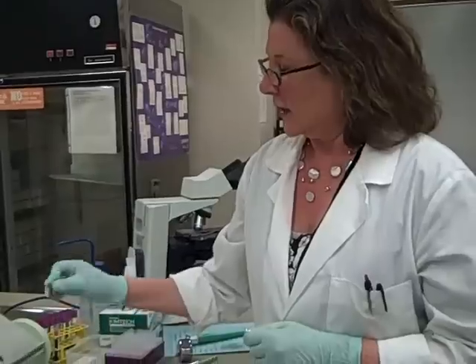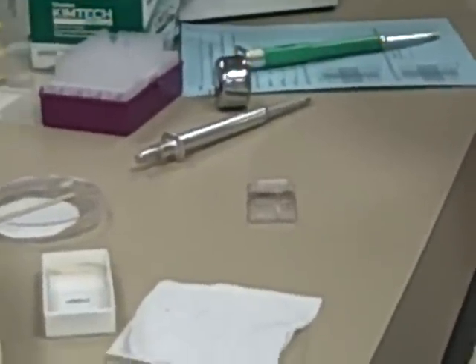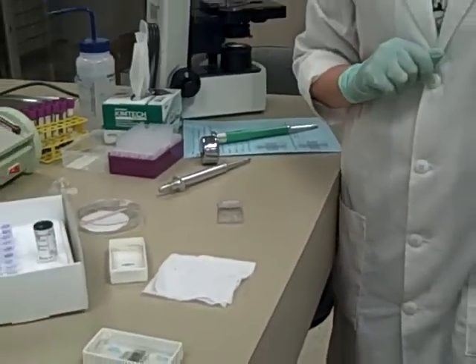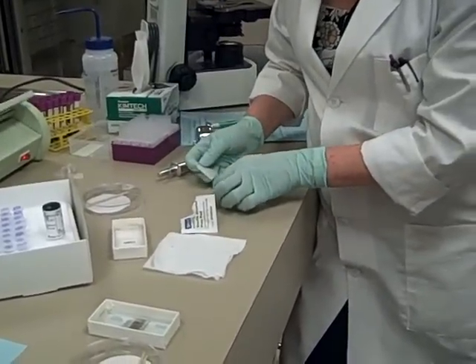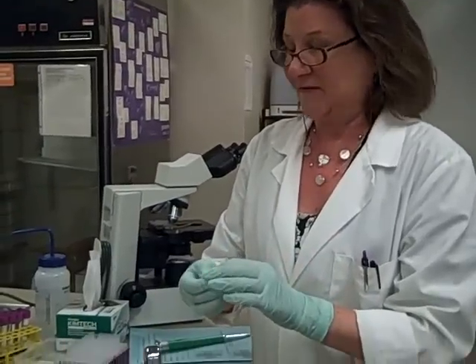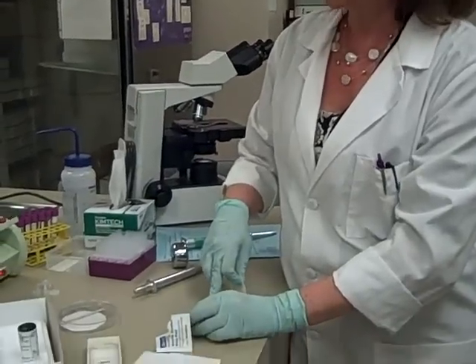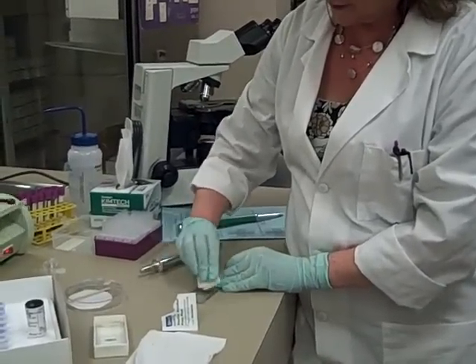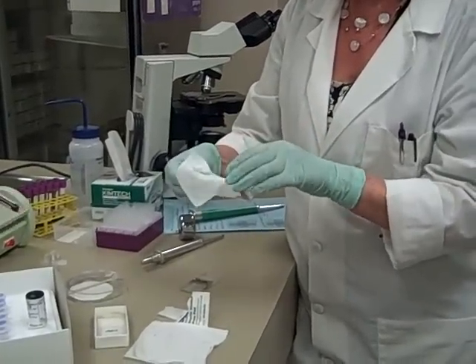That little one needs to be mixed before I plate it up. I'm just worried about it leaking out of the sample cup. Here's my hemocytometer, and you can count on it being dirty from the last person that used it. So the way you clean these is just with an isopropyl alcohol prep. You're going to do it carefully — pick up the coverslip. These are special coverslips; they're heavier than the ones you're used to and they're about five dollars a piece, so just be really careful with it. When you clean it, you only want to handle it by the long edges. To clean the hemocytometer, you're just going to gently take your isopropyl alcohol prep and wipe it clean, then with a Kim wipe you can dry it off carefully.